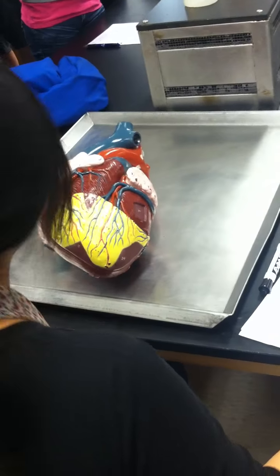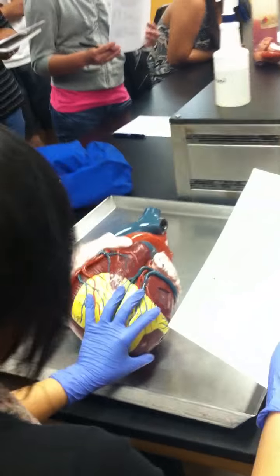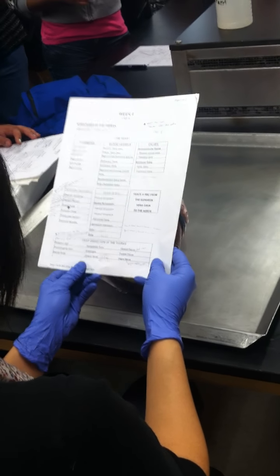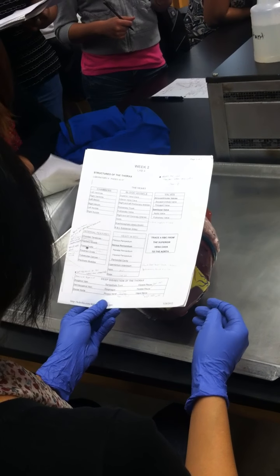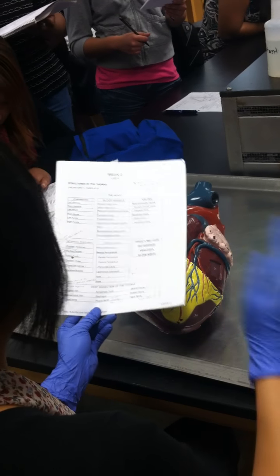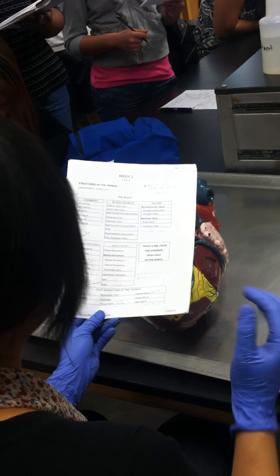Where it says deep dissection of the thorax, I'm just gonna go through some of these terms real quick before we get started on dissection. One of the most important terms, if I had to pick: visceral and parietal pleura. What's that regarding? That's covering what organ? The lungs, right? Visceral pleura covers the lungs, parietal pleura covers the thoracic cavity holding the lungs. Remember that? Remember we did that last week?